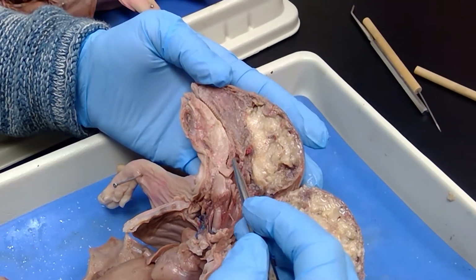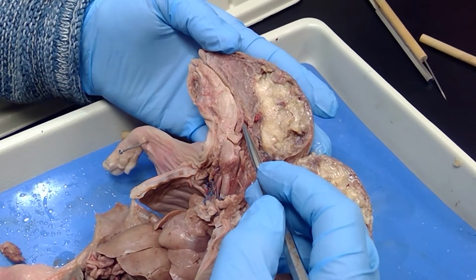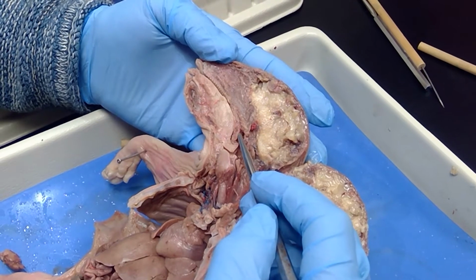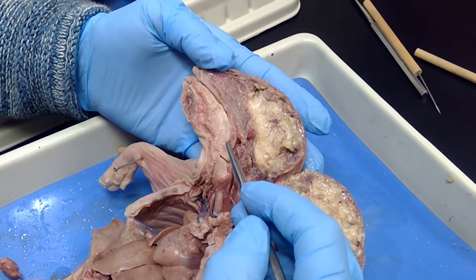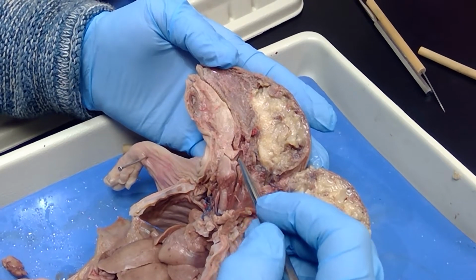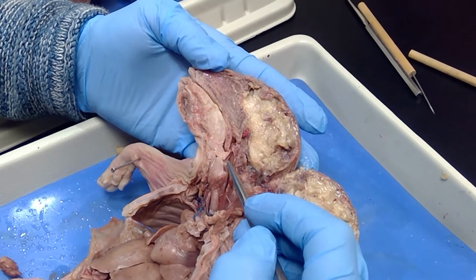This entire structure right here is the pharynx. This is the nasopharynx. Notice that here's the nasal cavity. This is the soft palate, so it's right above the soft palate. Come back just a little bit. This is the oral cavity here, so your food would come in through this right here. So this is the oropharynx, and this is the laryngopharynx. This is the larynx, that enlarged larynx here.